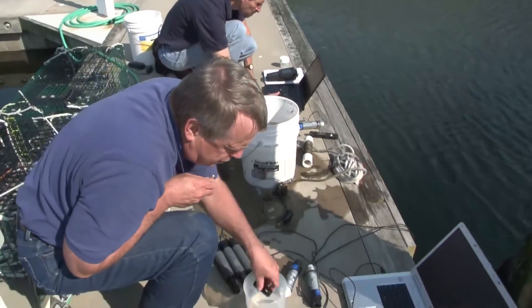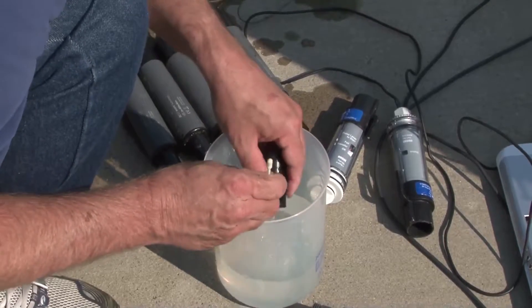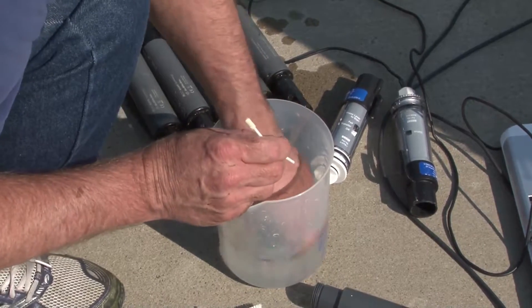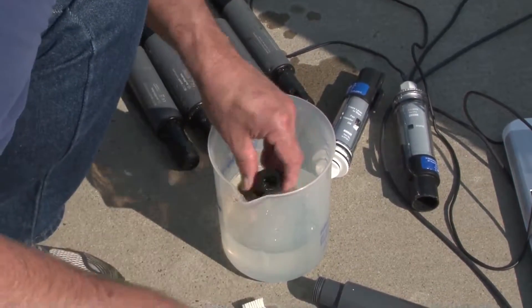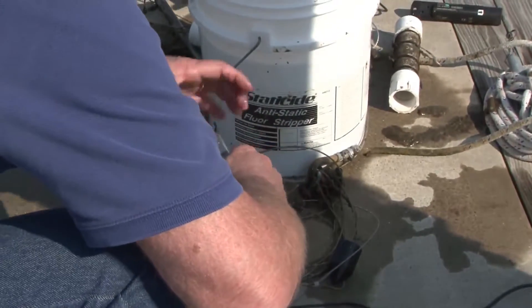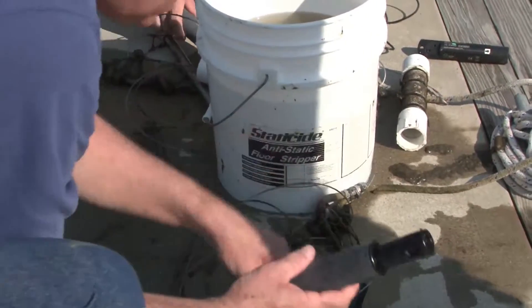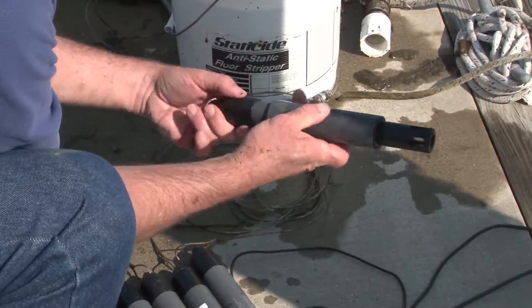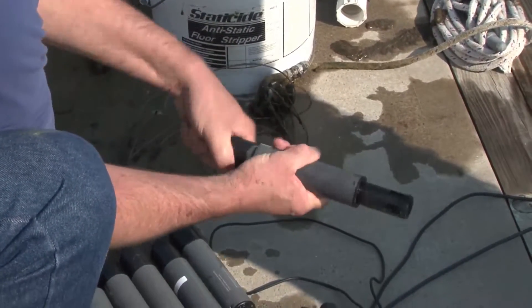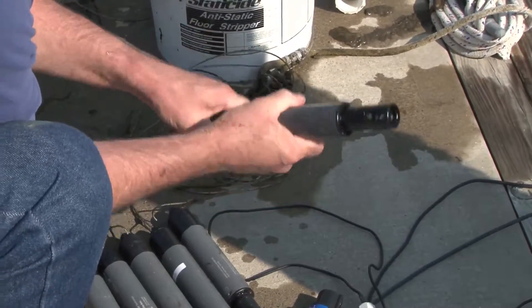Looks pretty good. We rinse that in fresh water. This doesn't matter as much because it's not the actual sensor — it's just protecting the sensor. It's pretty good. We put the cover back on, and this cover as well, which also supports it on the cable. And then we're ready for redeployment.